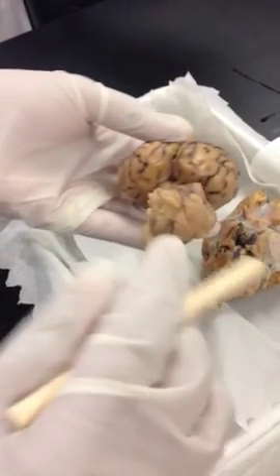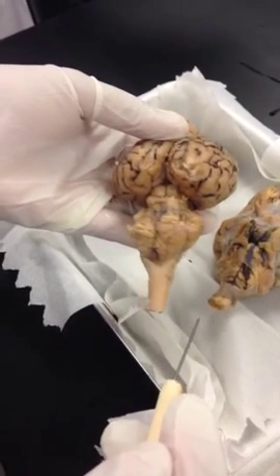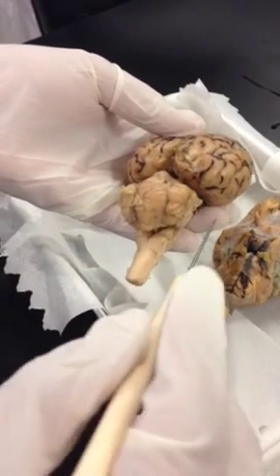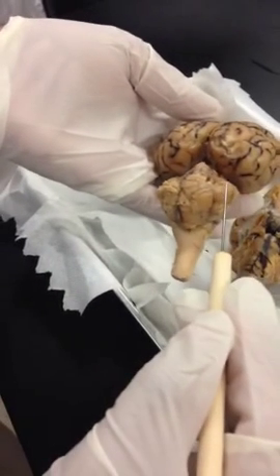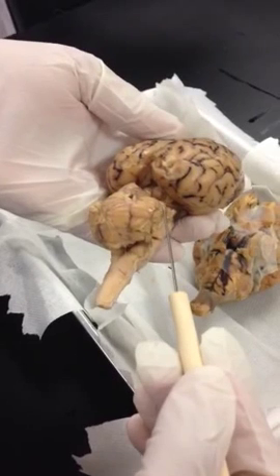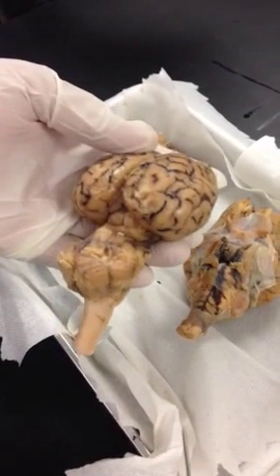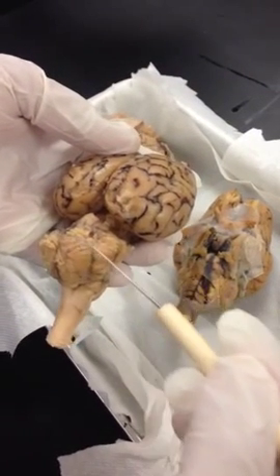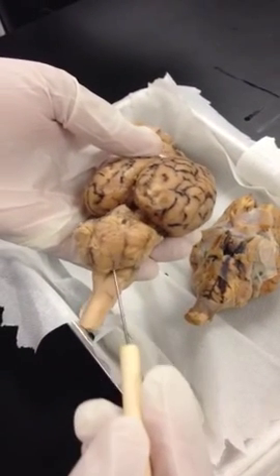Cerebellum. Cerebellum, this entire structure. Name the entire structure. You are saying cerebellum. Lateral hemisphere of the cerebellum. You can see two hemispheres like your cerebrum. So one on the right, one on the left. This is the lateral surface of the hemisphere, lateral hemisphere of the cerebellum. Vermis. Vermis is this middle portion. You can see these worm-like structures in the middle between the two hemispheres of the cerebellum. That's your vermis.